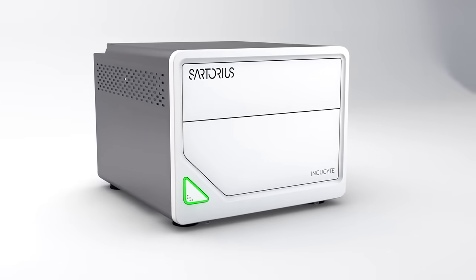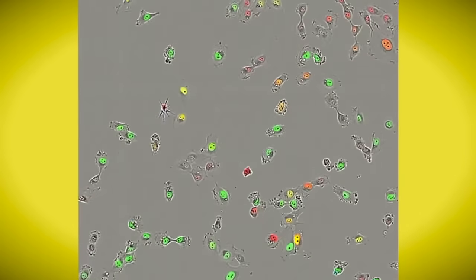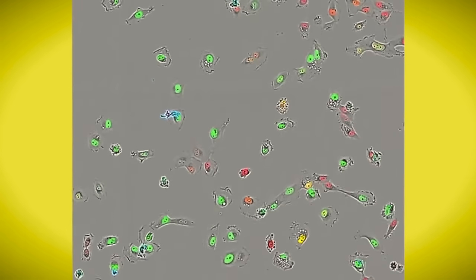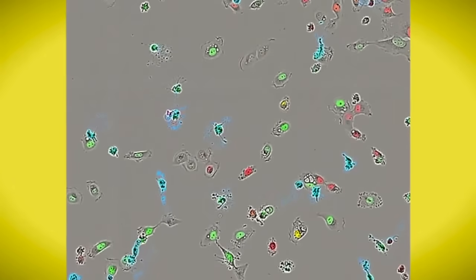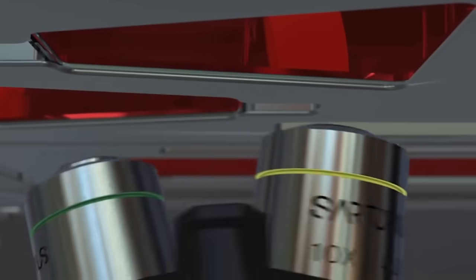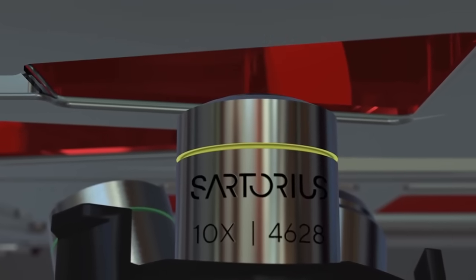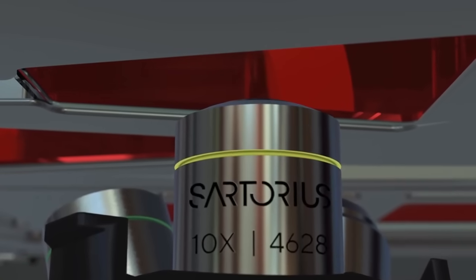Now, with the SX5, we're introducing our patent-pending image acquisition and analysis for up to three fluorescence channels in HD phase in a single live cell experiment. We've very carefully selected the channels, including long wavelength, low phototoxicity light that's appropriate for long-term time-lapse experiments. And we've included all the necessary acquisition, processing, and analysis tools.